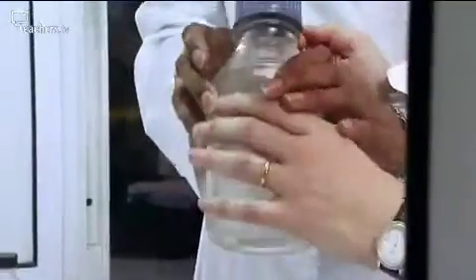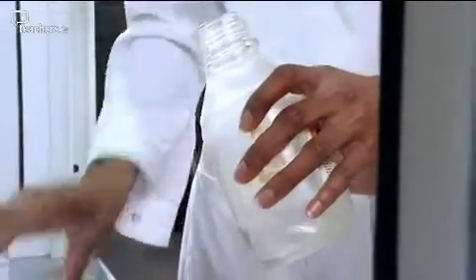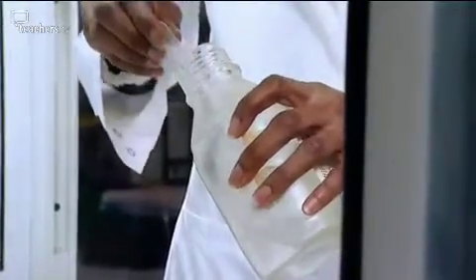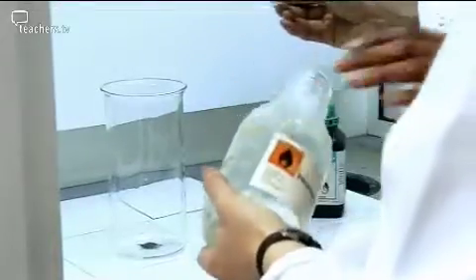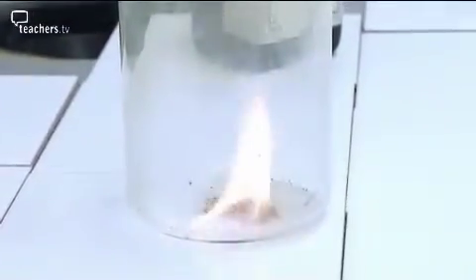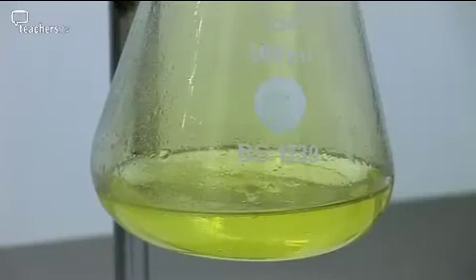But we're encouraging a reaction with a drop of propanone. It should ignite the propanone. So if you'd like to just... And that's my job. That's your job. Just bring your hand away. Whoa. Oh my goodness. That was quite frightening. That was only a drop, and we've only used a tiny amount of the two chemicals.